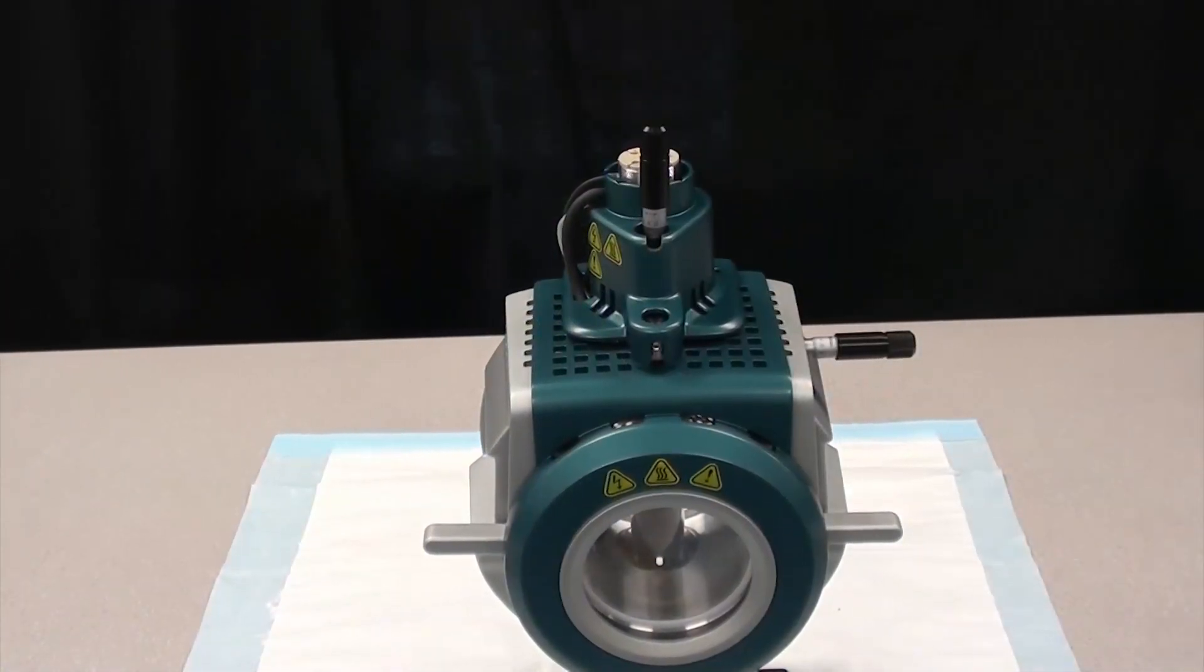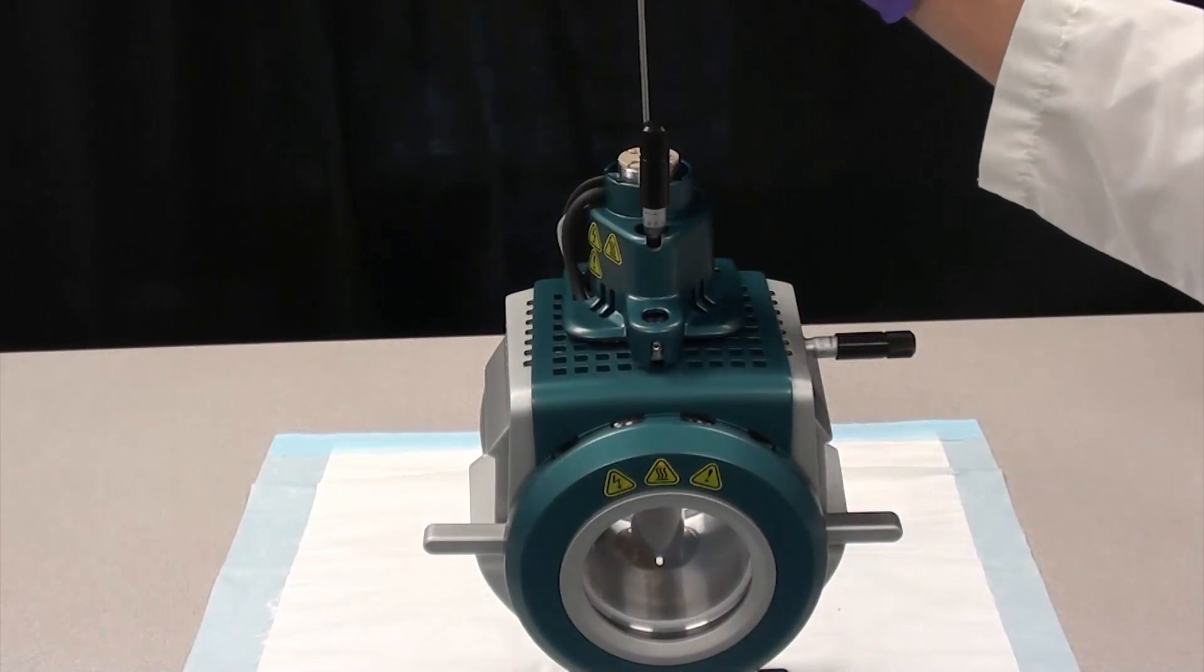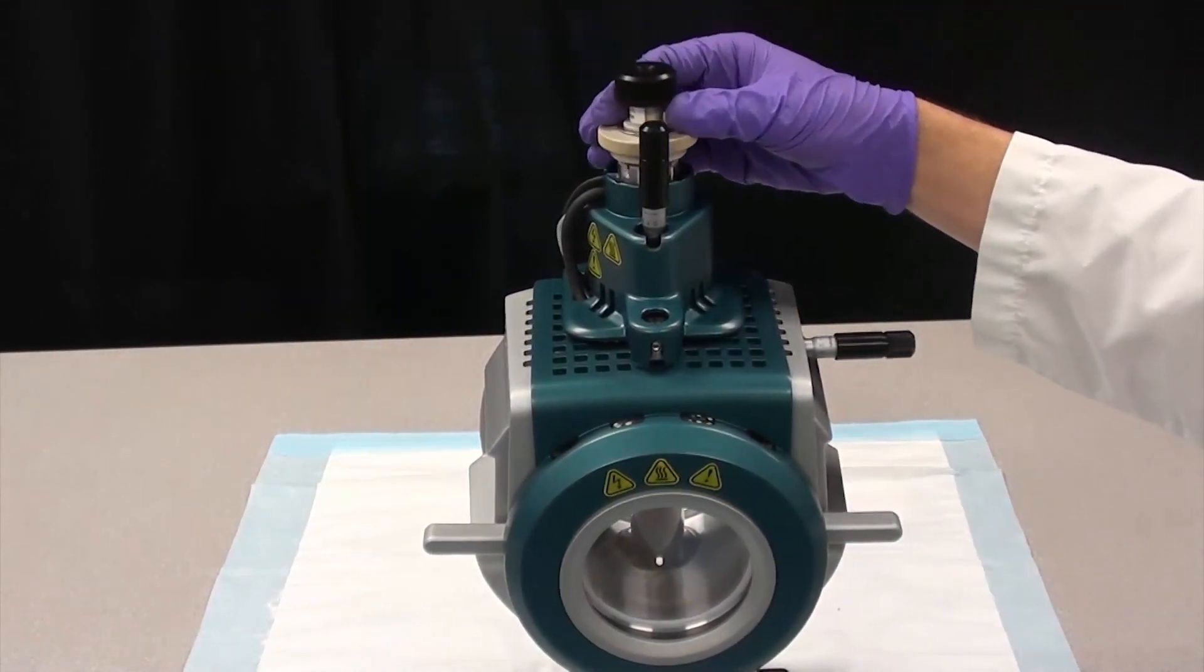Before installing the ion source on the mass spectrometer, install the probe on the ion source.